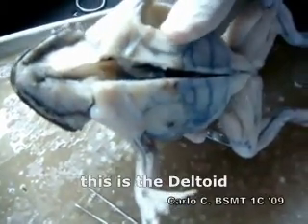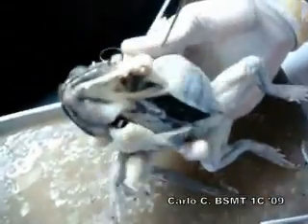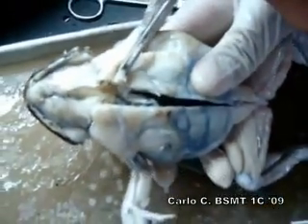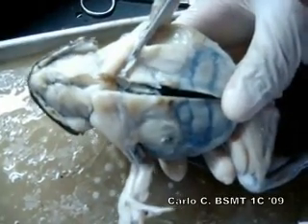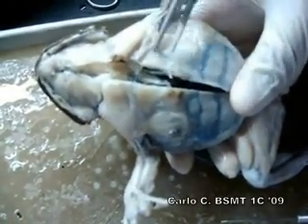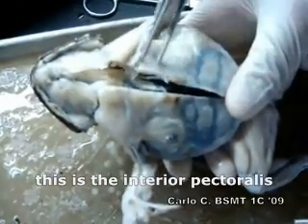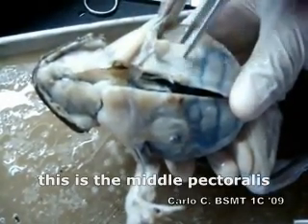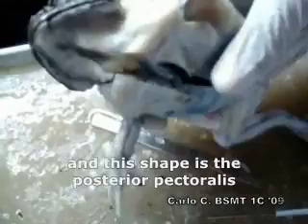The thoracic or chest muscle. This is the deltoid. Below that is the sternoradialis, below the deltoid. These three are collectively called pectoralis: this is the anterior pectoralis, this is the middle pectoralis, and this paddle shape is the posterior pectoralis. The triceps is this part.